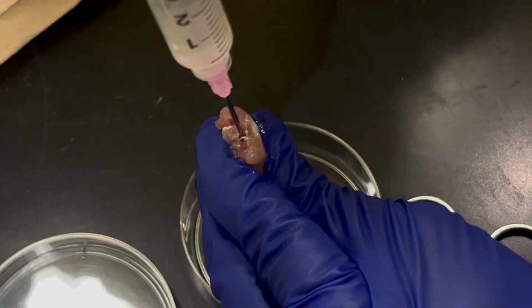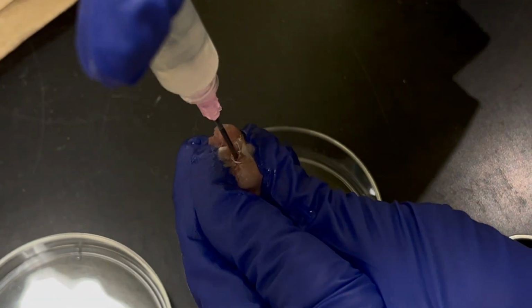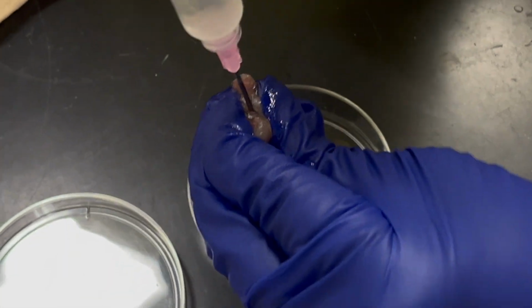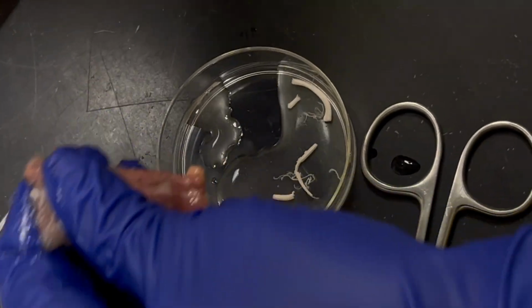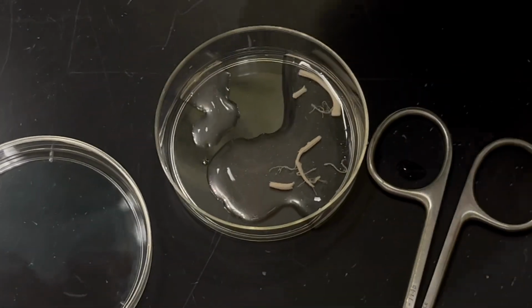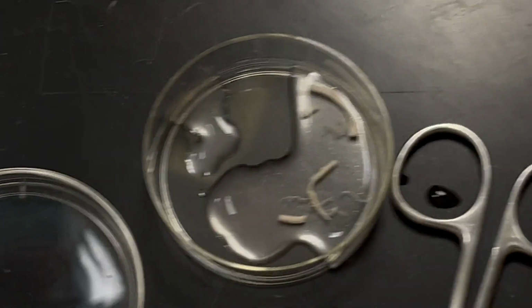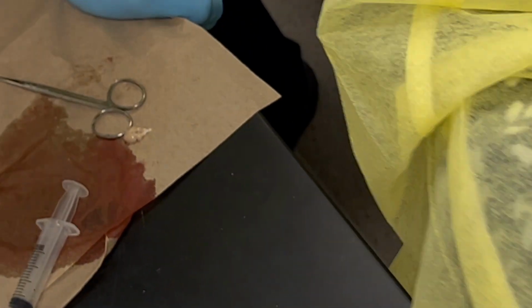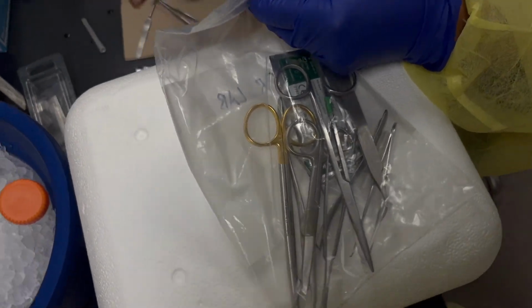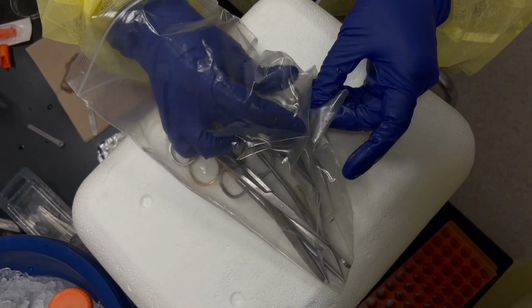I can give it a try. Yes. Oh, I broke it, but it could be okay. Let me show you where everything is. This is not the one. That's where we're practicing. When you go in with a needle, you go in until you can. I'll let you feel next time so that you can see what I'm talking about.